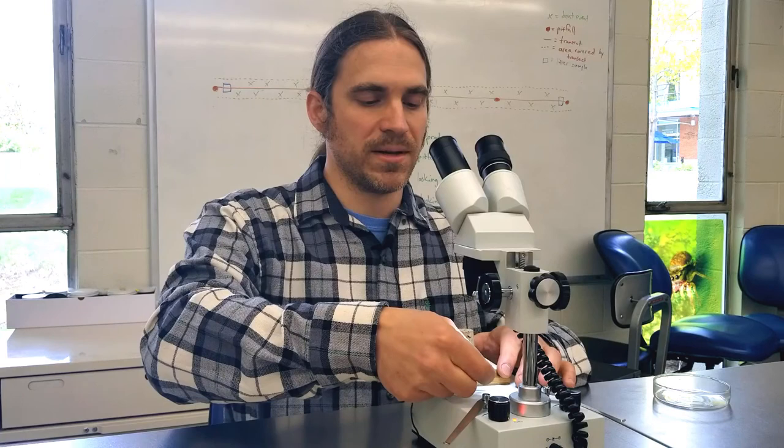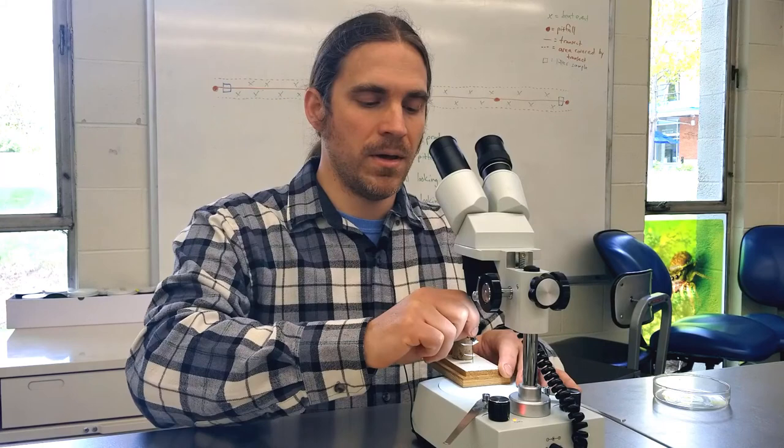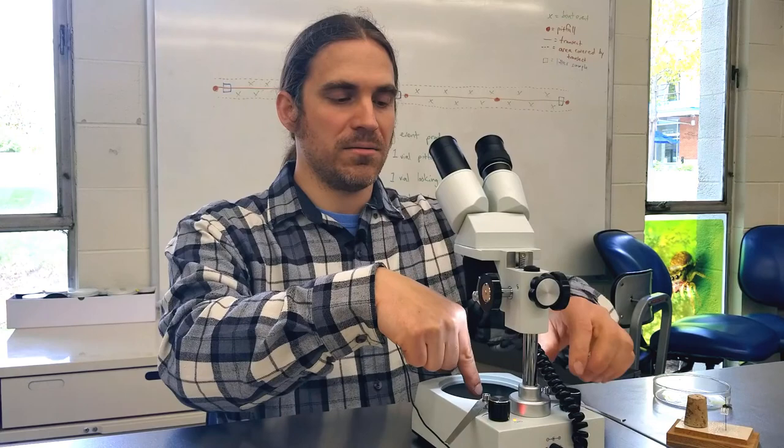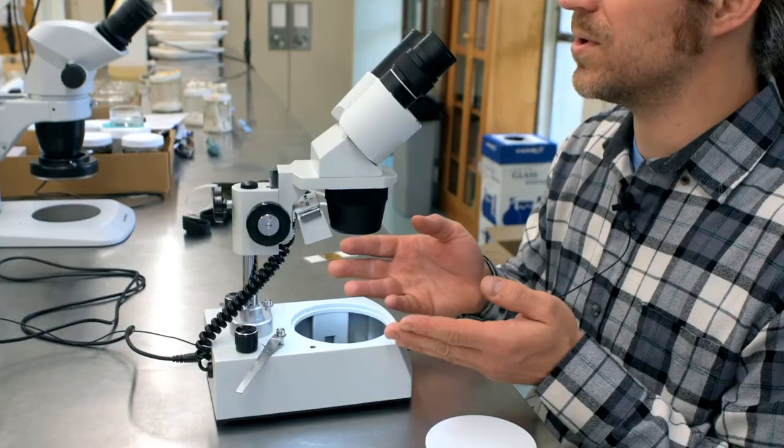This model and many others also have a second stage that is completely glass. There is a secondary light down in here that you can turn on. If you want bottom illumination, you can use the glass plate and get bottom illumination to look at certain samples. For insect identification, that's not generally used, but it can be useful in sorting certain types of samples or for other types of objects.